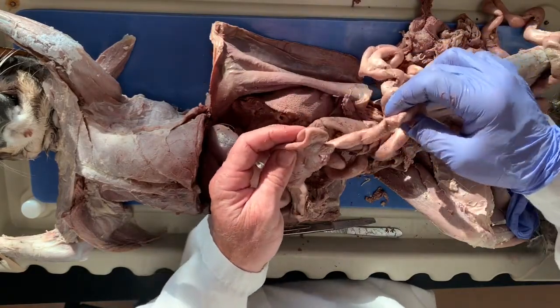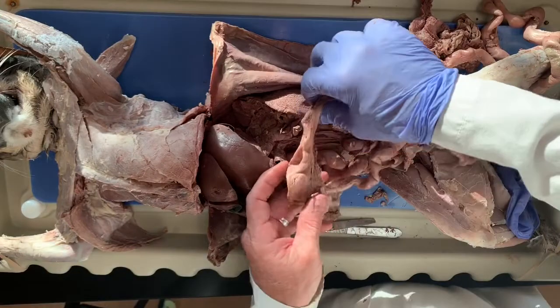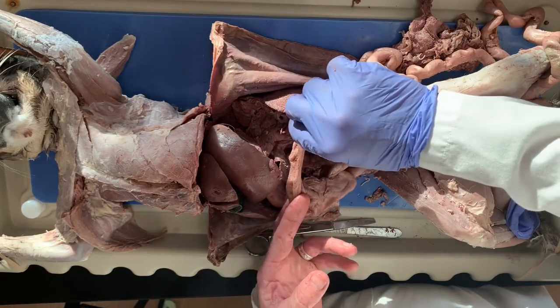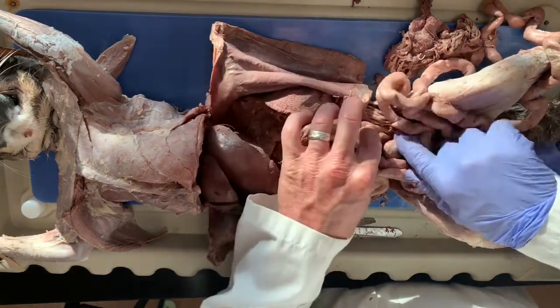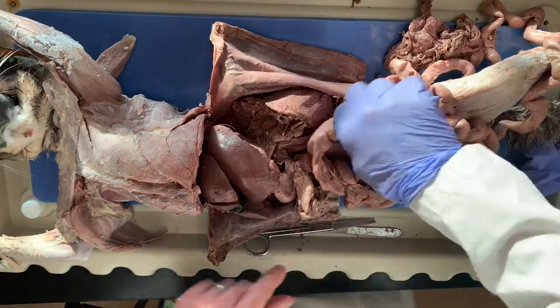So what I can do now, I'm going to show you how it sits in the body. So you have the ascending colon that comes away from the small intestine. You have the transverse colon that comes across the body, and the descending colon, which descends towards the sigmoid colon, which is the last kind of turn, and then down to the rectum in that passageway there.